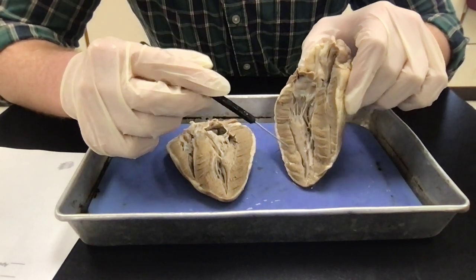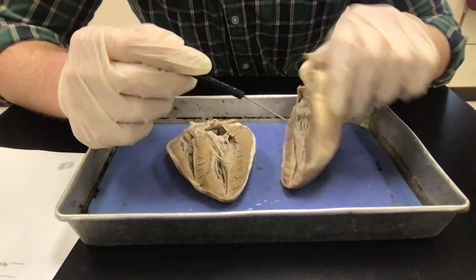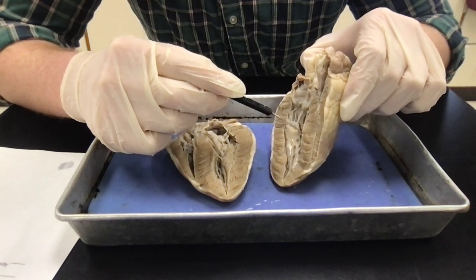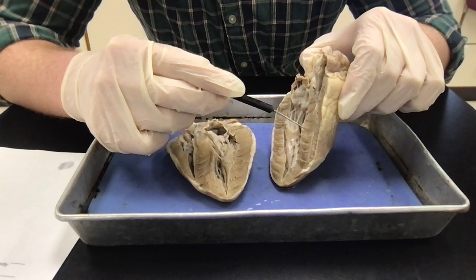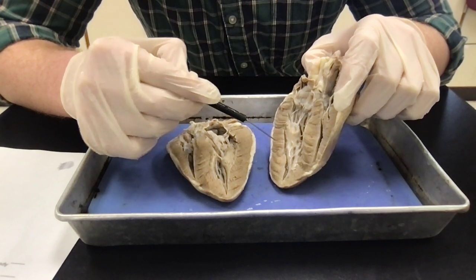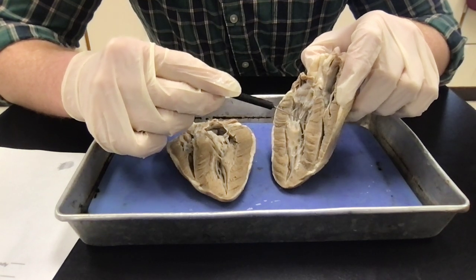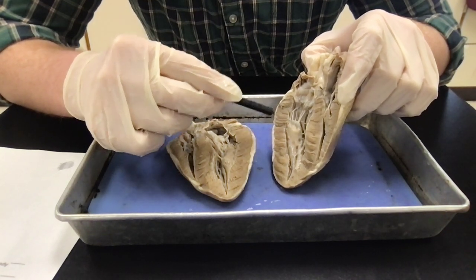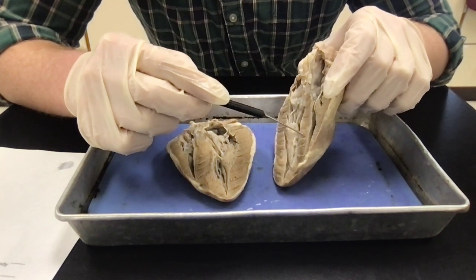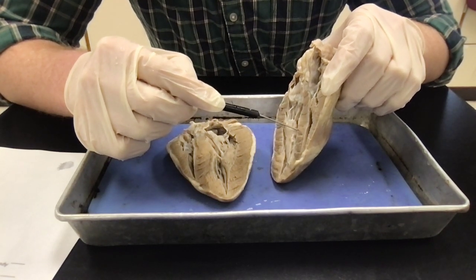The three membranes of the heart: the very outside membrane, you can kind of see here this brownish substance, that is your epicardium. Your myocardium means muscle, and that is the thickest layer, and it goes from here to here, right? It's this big light brown layer, very thick. And then the very inside layer is going to be your endocardium. It's going to be the coating of all of the ventricles and the atria, so all the chambers of the heart, the lining tissue is going to be your endocardium. Okay.